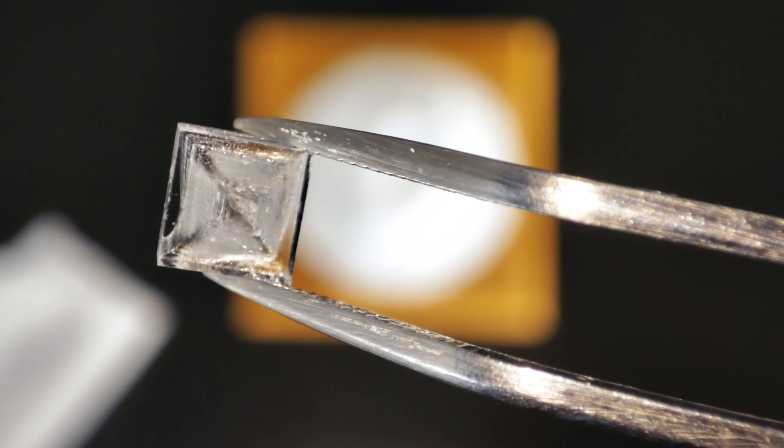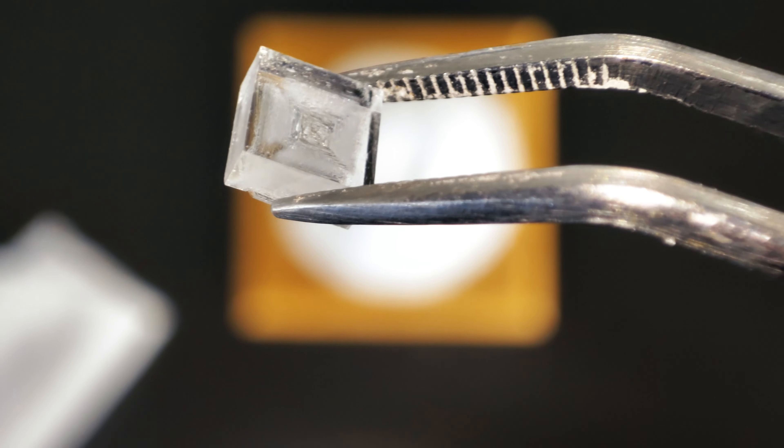Through the process of recrystallization, the typical granular form of salt can undergo a transformation into these distinct cubic crystals.